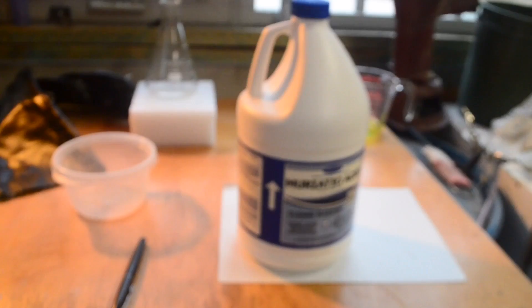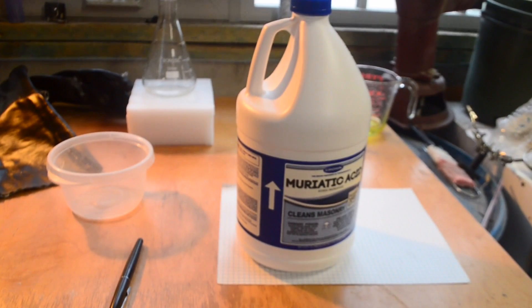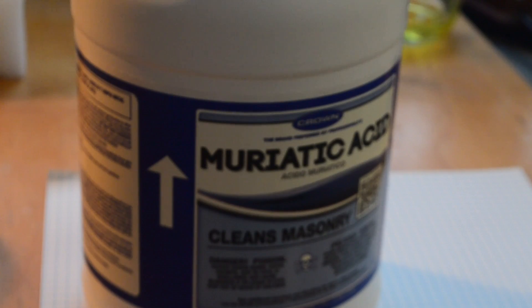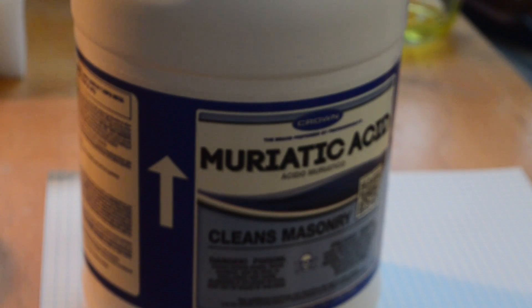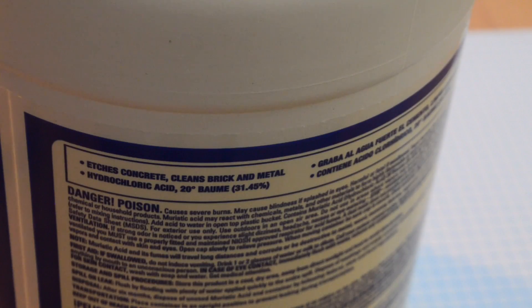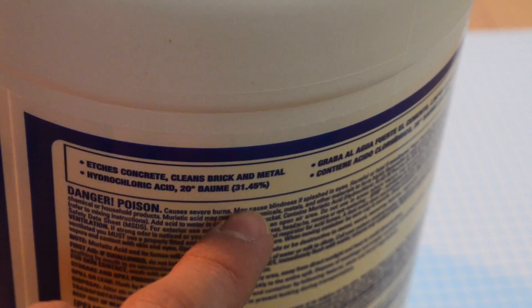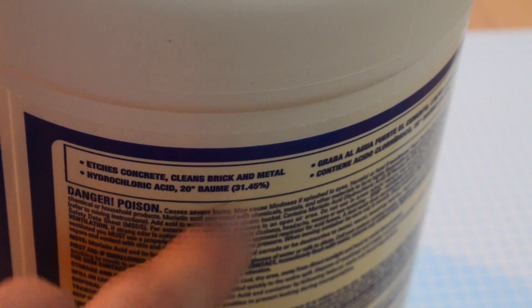The first ingredient we're going to be using is aluminum foil, and the second ingredient is muriatic acid. Muriatic acid is pretty cheap and can be found at most hardware stores — I bought this whole gallon bottle for around $7. Muriatic acid is really just diluted hydrochloric acid with a few impurities. As you can see, this muriatic acid is around 31.45% HCl.